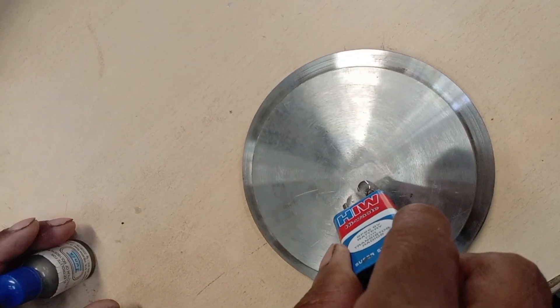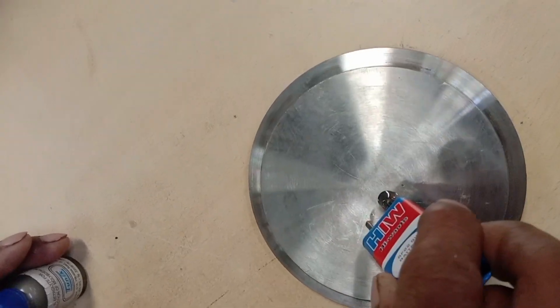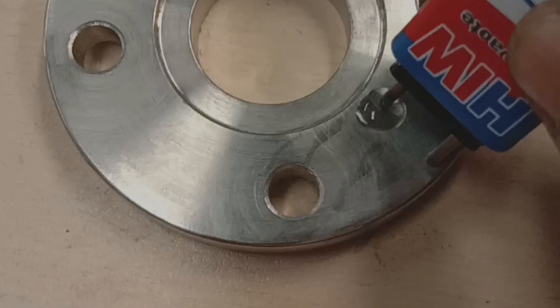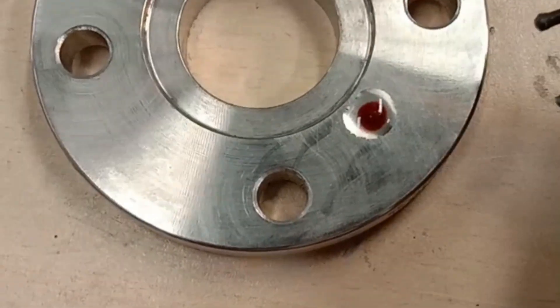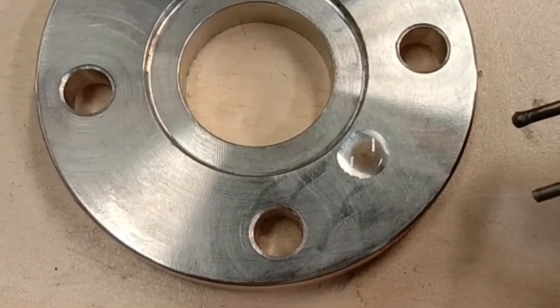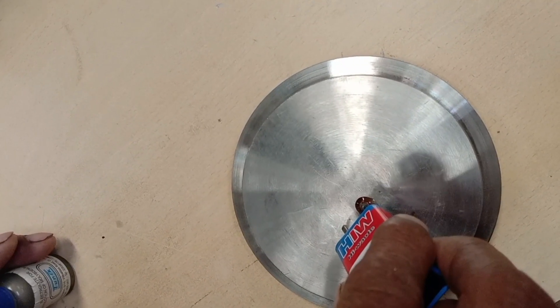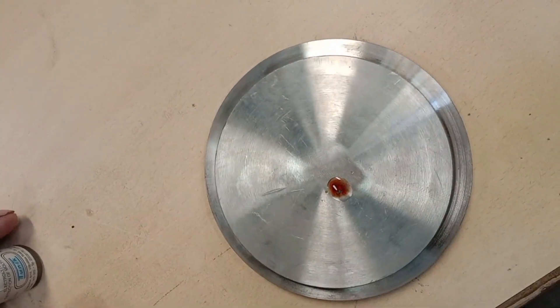Step 4: Remove the battery after the drop has developed color. Check carefully — if the drop develops a black color and remains as it is, the material is identified as SS202. If the drop develops a red color and disappears immediately, it is identified as SS304 material. If the drop develops a red color and remains for a longer time, it is identified as SS316 material.